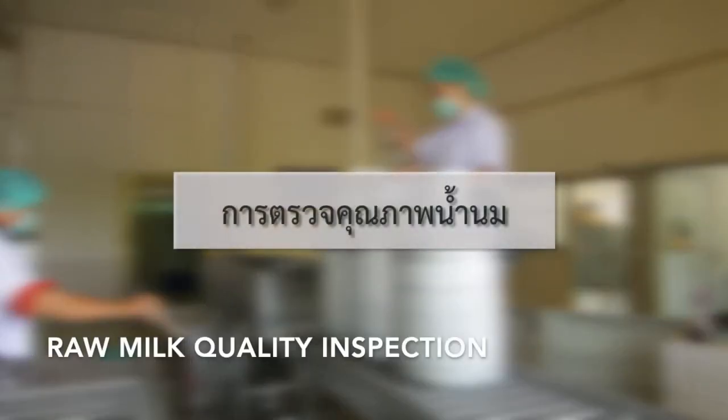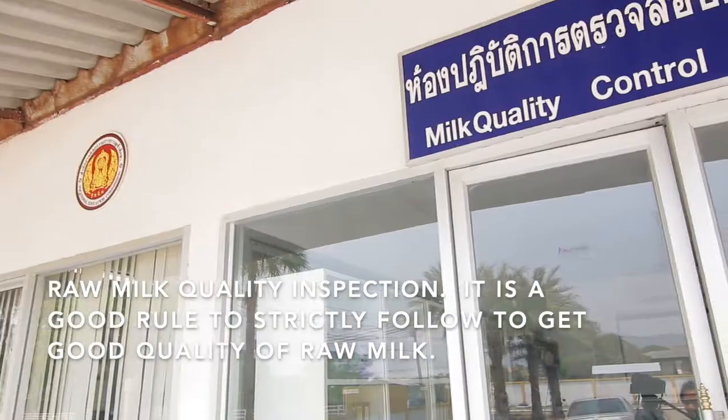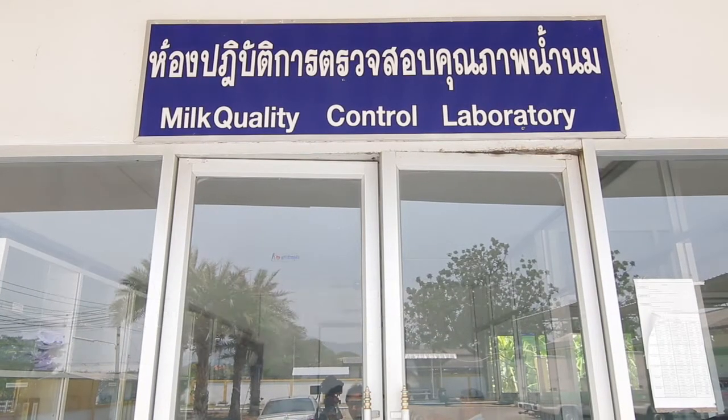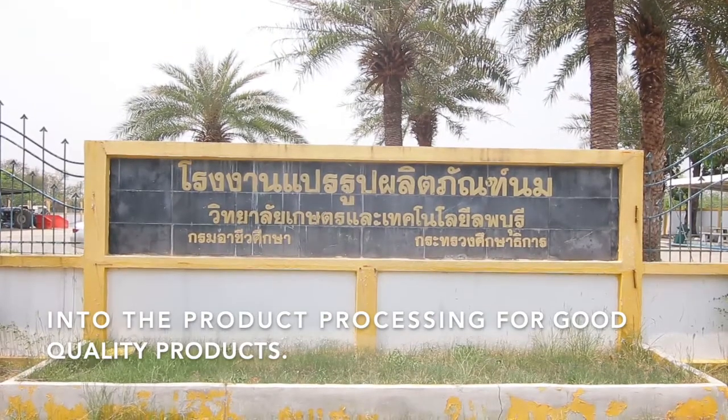Raw milk quality inspection. This is a good rule to strictly follow to get good quality raw milk into the product processing for good quality products.